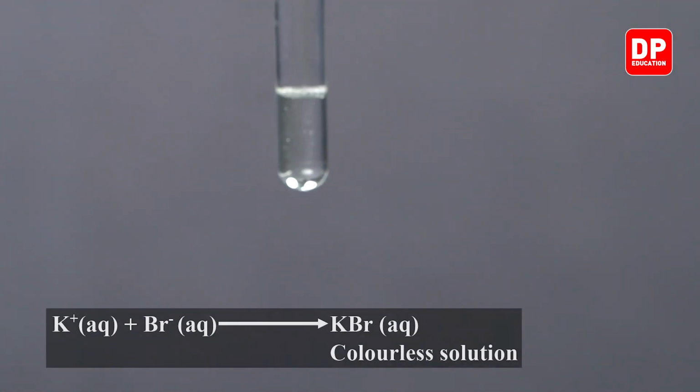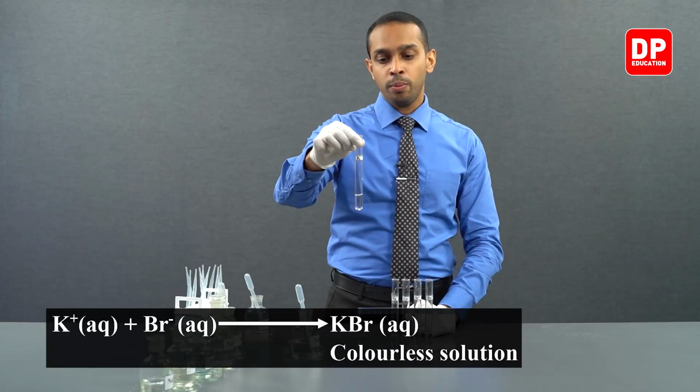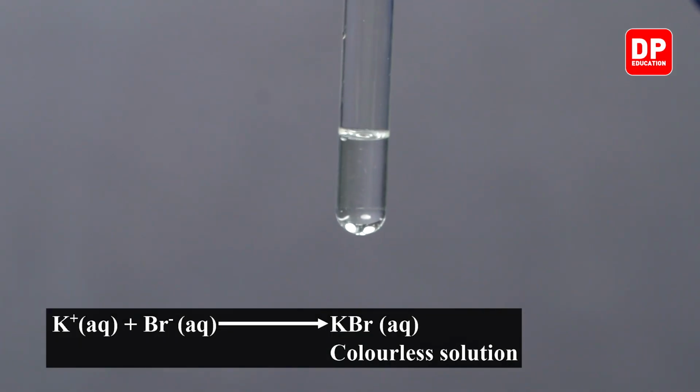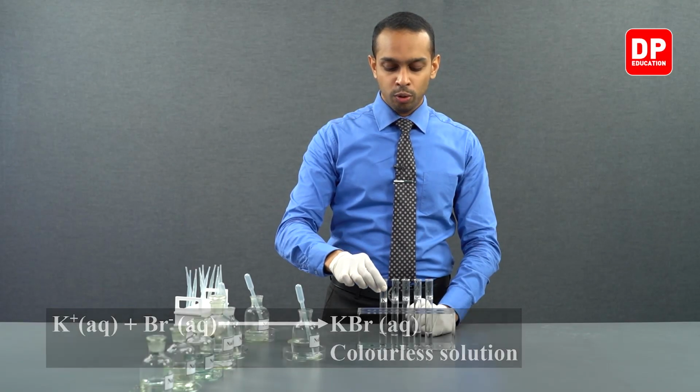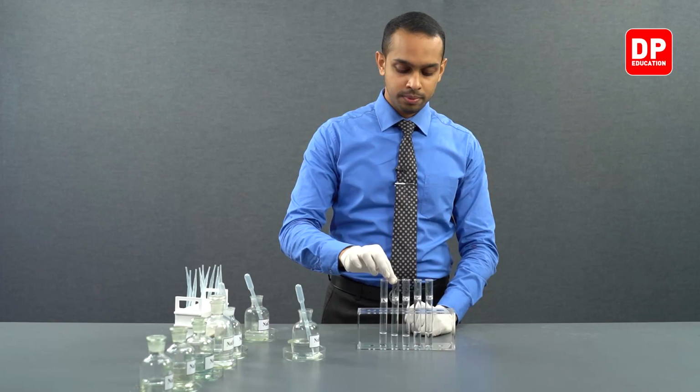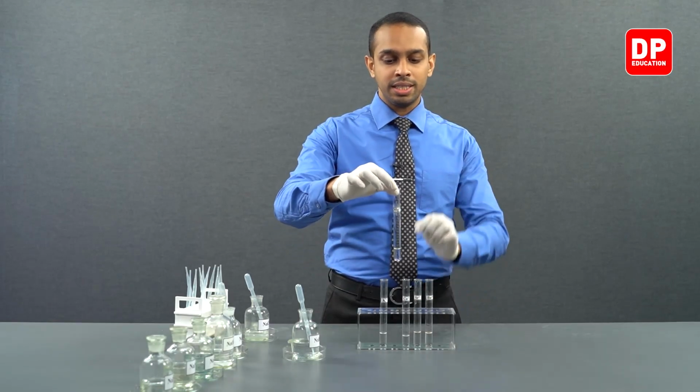As you see, students, upon addition of bromide ions into potassium ions, there is no precipitate formed, indicating the potassium bromide that is formed here is soluble in water. Now we have our magnesium.